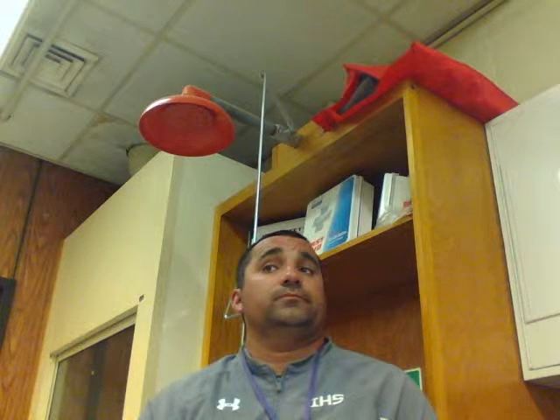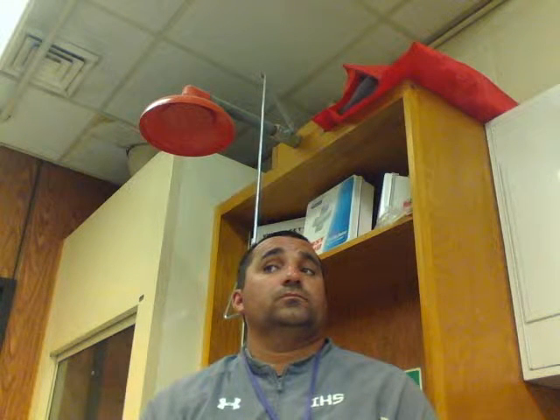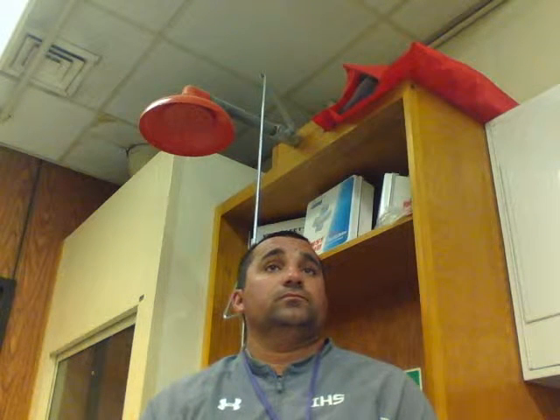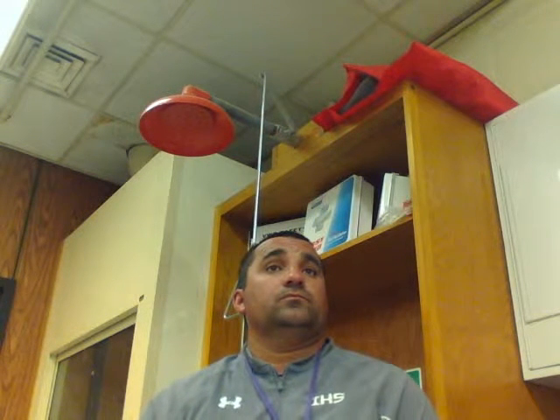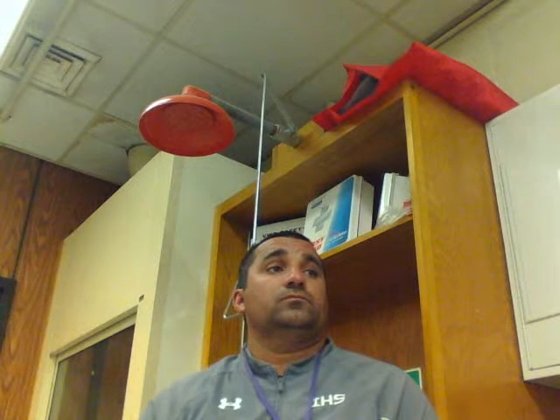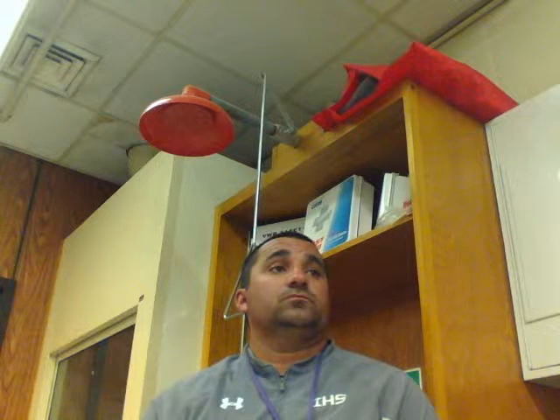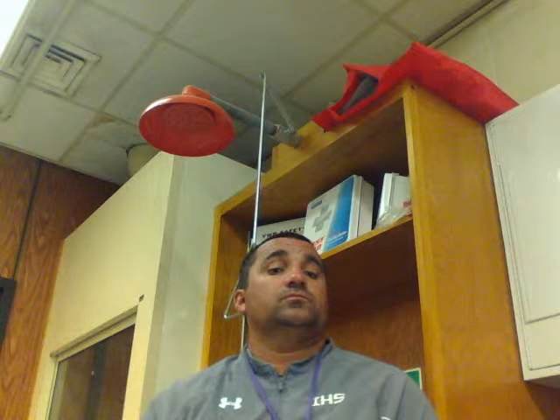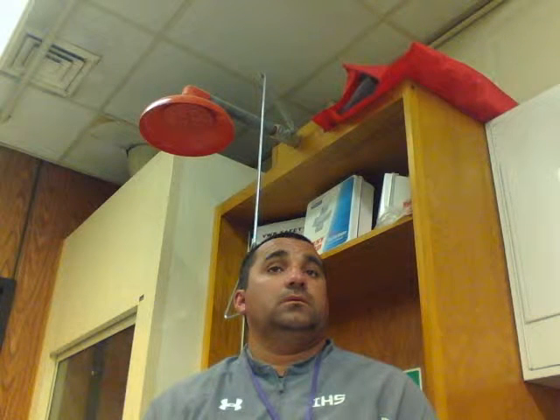See, did you adjust your coarse knob? There you go. Always use the coarse first. Guys, you want to get it as clear as you can with that coarse knob first. Then fine. So remember, as one person is doing something, make sure we're answering the questions that are on there. Like this question.